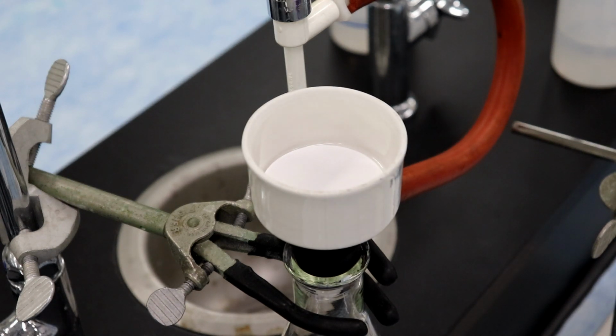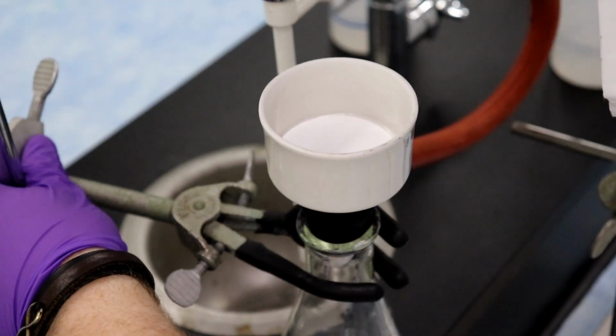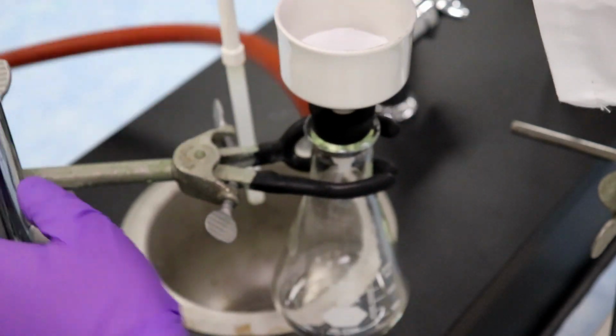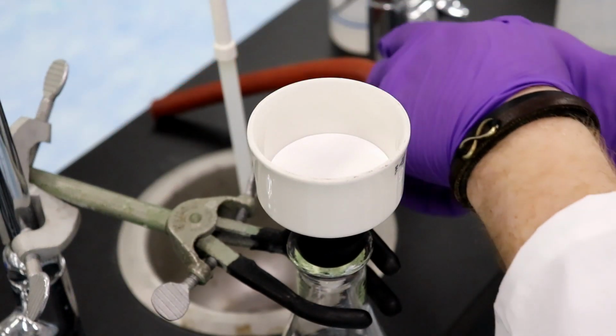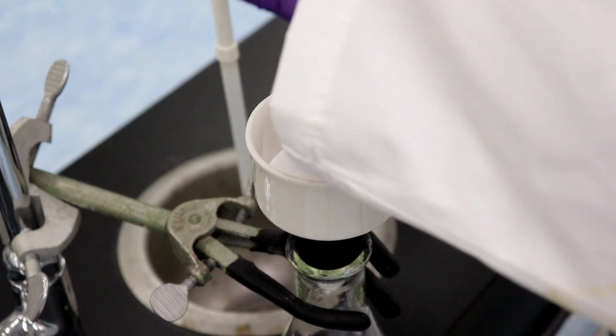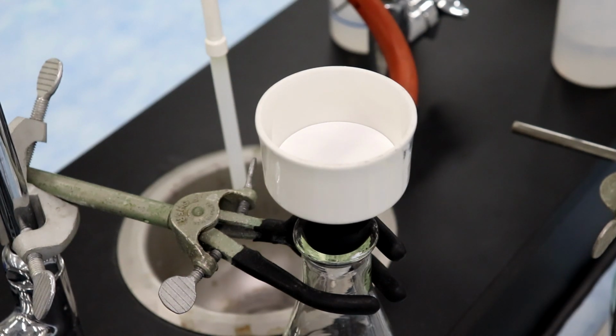Now we're gonna do the following. So we're gonna turn on the water right here. Oh, hold on. That would have splattered water everywhere. So we'll move that back. Oh. Move that over there. I almost turned the faucet on when the thing wasn't above the drain. Yeah, that would have been a mess. That would have been an absolute mess. Okay, we're still good.